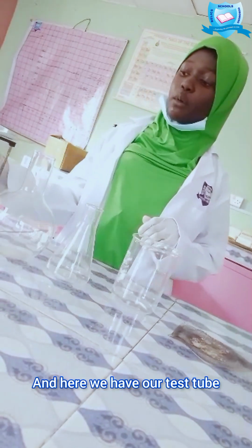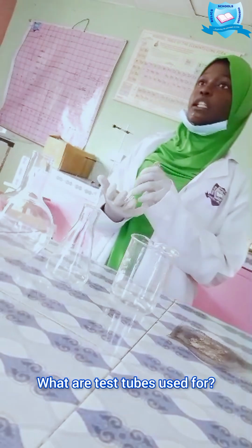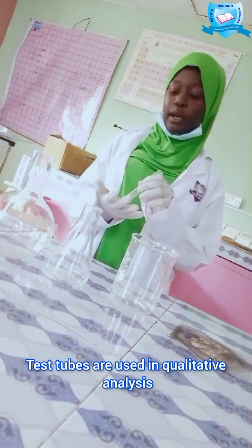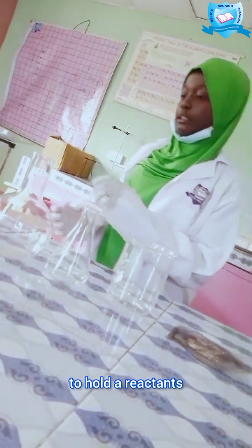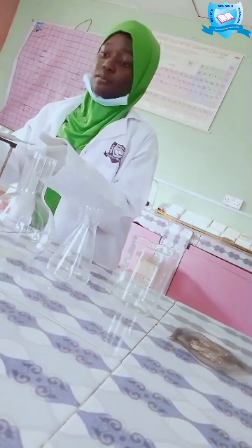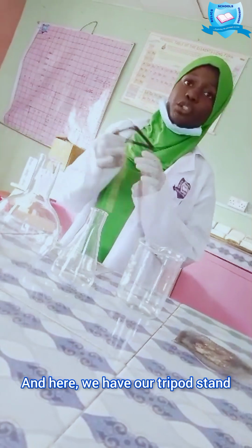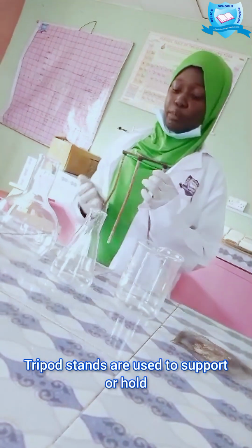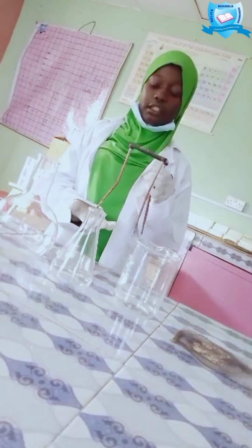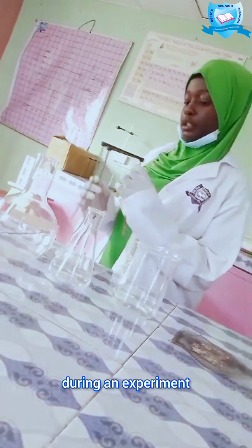And here we have our test tube. What are test tubes used for? Test tubes are used in qualitative analysis to hold a reactant. And here we have our tripod stand. What are tripod stands used for? Tripod stands are used to support apparatus during an experiment.